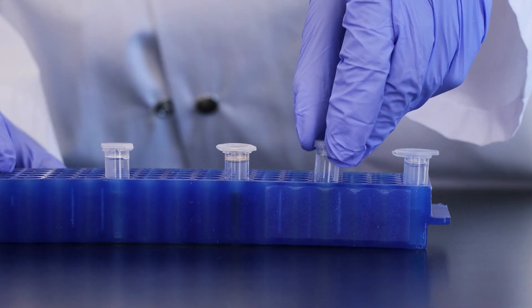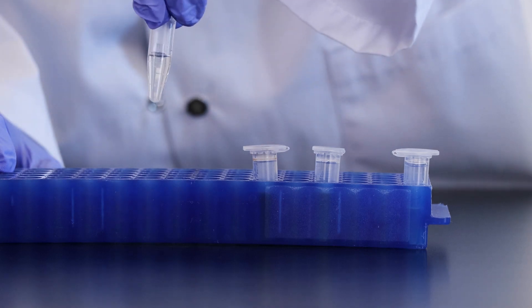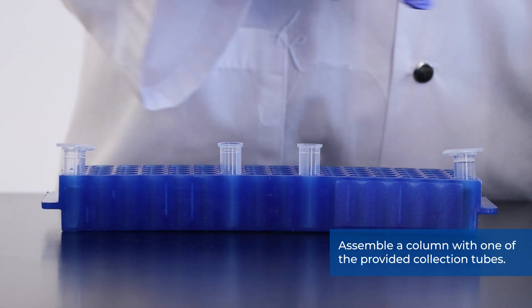Now that the samples have been lysed, we will complete the purification of RNA from our sample types. Assemble a column with one of the provided collection tubes.